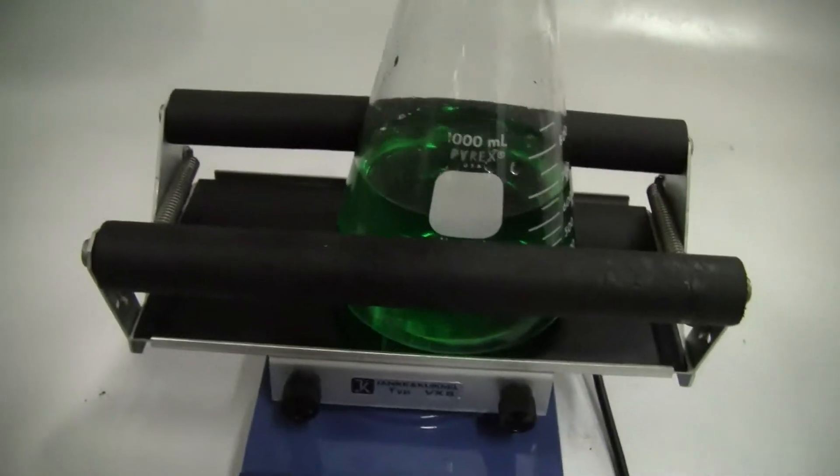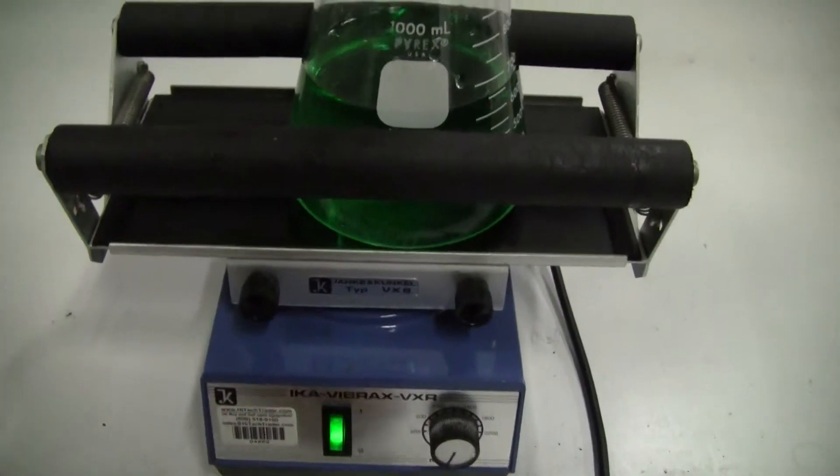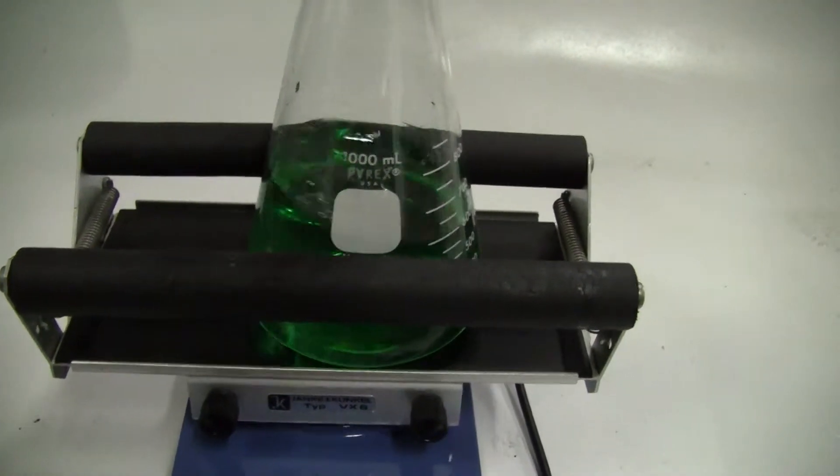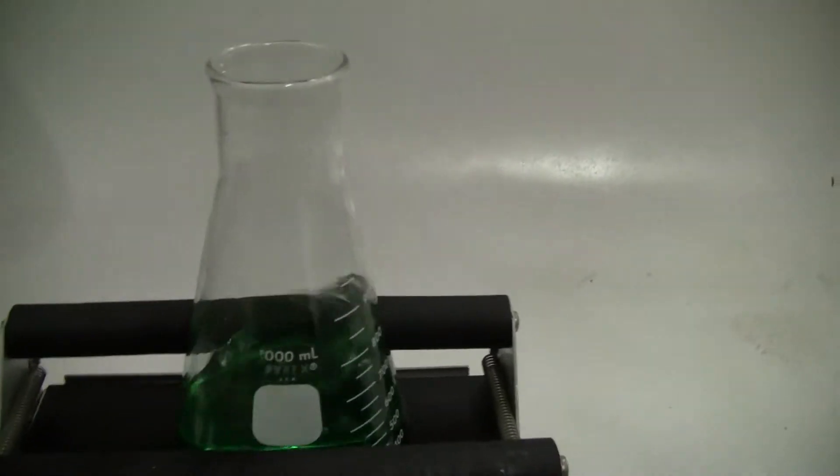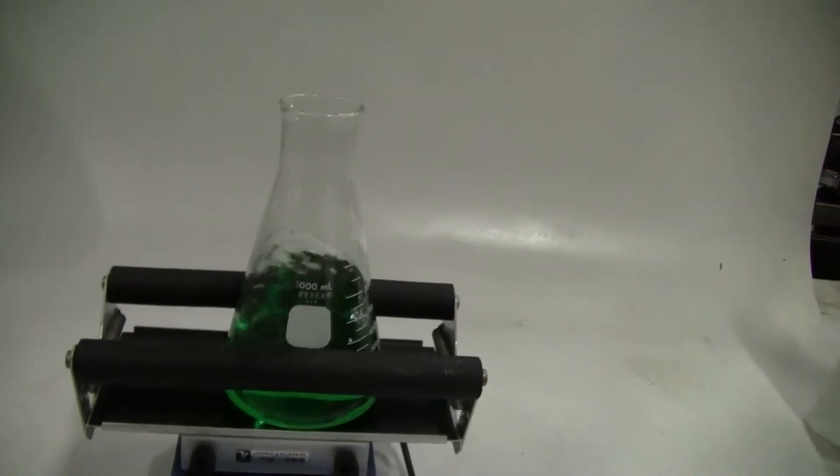Let's turn it on. Turn it up a little bit. See, it does work with the 1 liter. If it's capped, it would work easily.